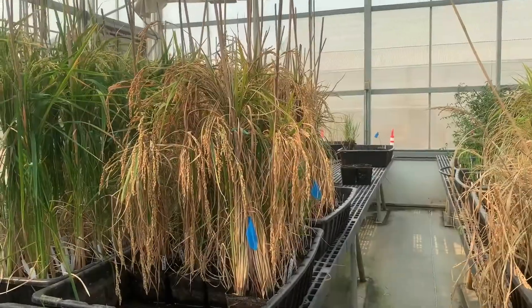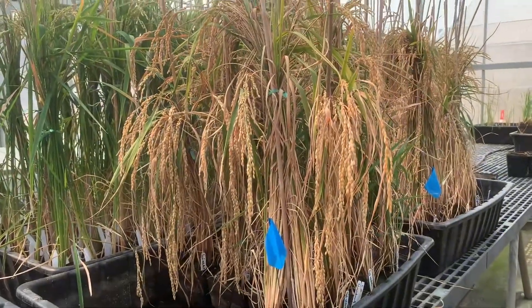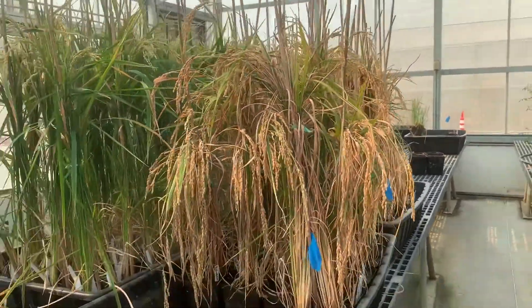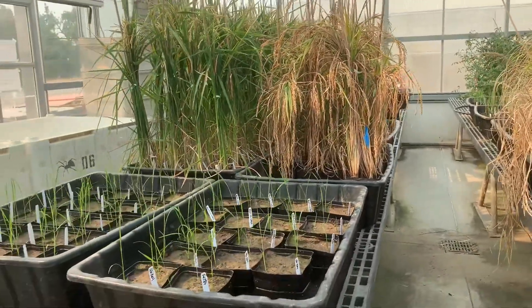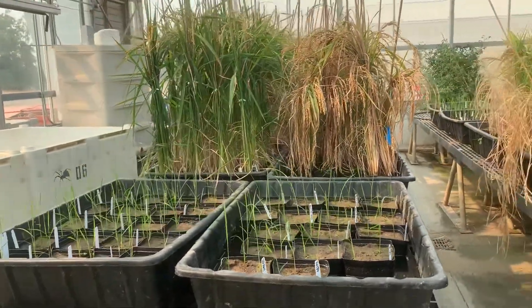In this lab, we specifically focus on rice, which is a staple food that billions of people depend on. Today we'll be showing you how we genetically transform rice using a technique called tissue culture. We use bacteria to insert genes into the plant genome so we can study what those molecules do for the plant.